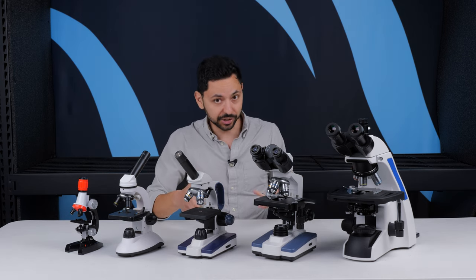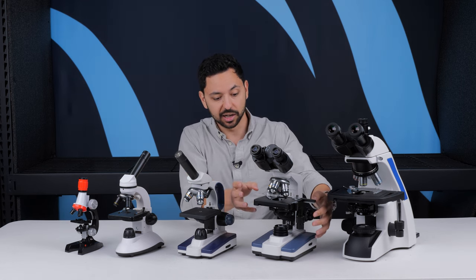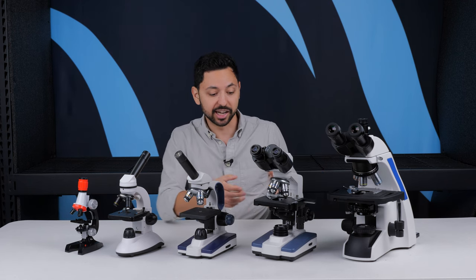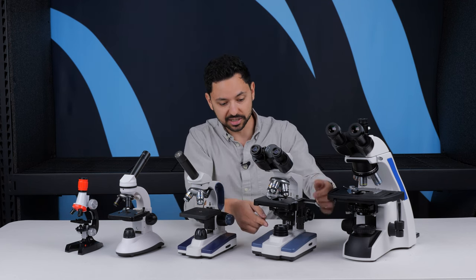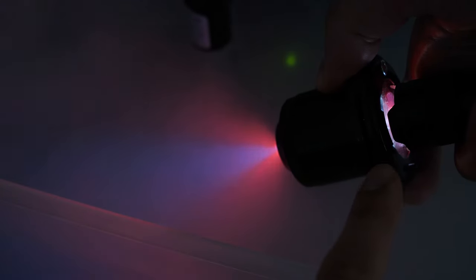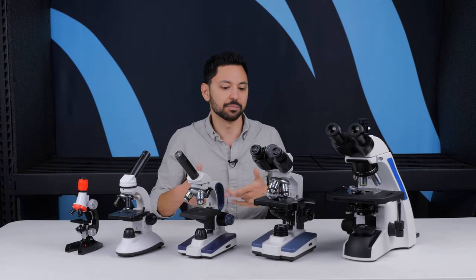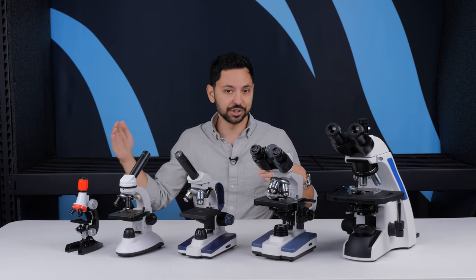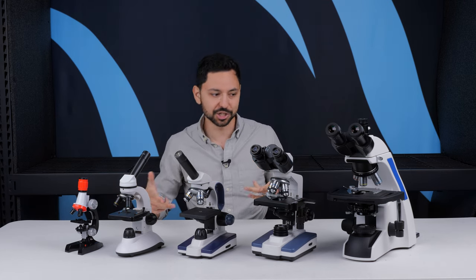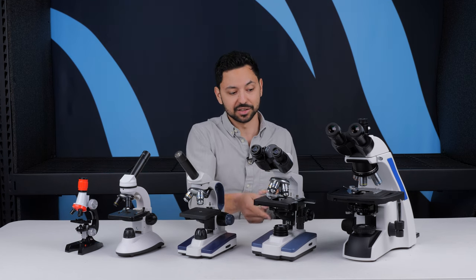The other things that are typically included in a compound microscope, which are rather important to operation, is a highly precise illumination setup. On this microscope, as an example, there's a light source at the bottom that goes through a condenser lens, which essentially focuses the light at a specific angle onto the sample so that you can get your sample illuminated from all possible angles. This gives you higher clarity at higher magnifications. The higher the magnification you go, the more sophistication is required to properly image that sample — hence the fancy illumination.